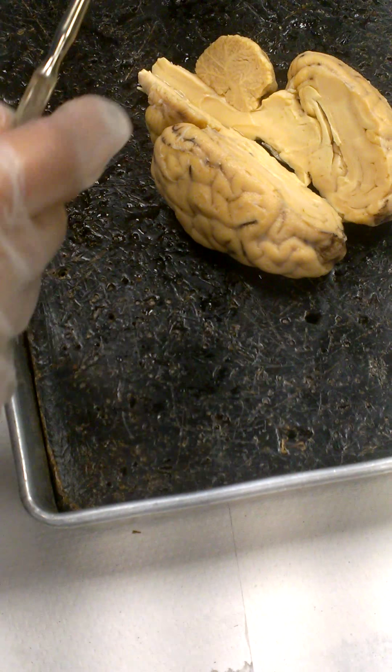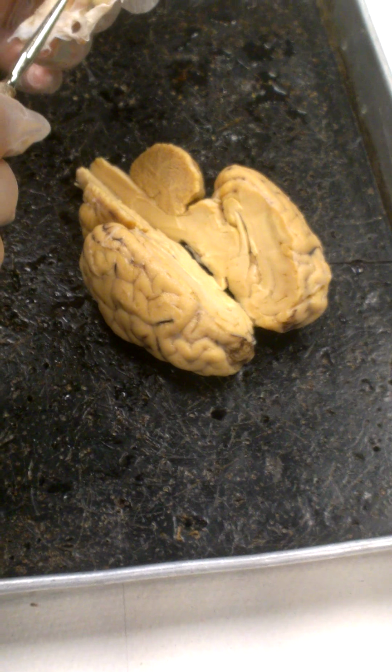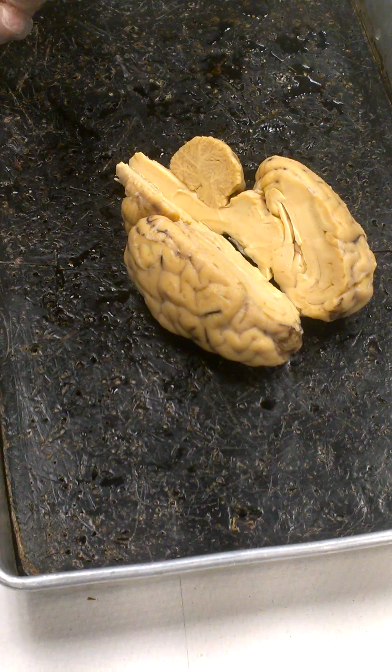So that membrane I gave you was once attached onto the underside of your brain. In order to see the cranial nerves, which is going to be our next step, we're going to have to remove this membrane. You can see this entire piece of membrane along with the pituitary gland, so that we can get down and look at those cranial nerves.